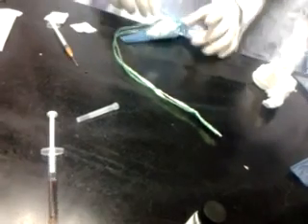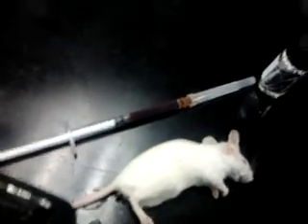The thing is to let it cool down first, then you use the other side. The vein is really cool. You can see part of the vein doesn't dilate very well. Okay, we use one of these mice here. It's much easier.